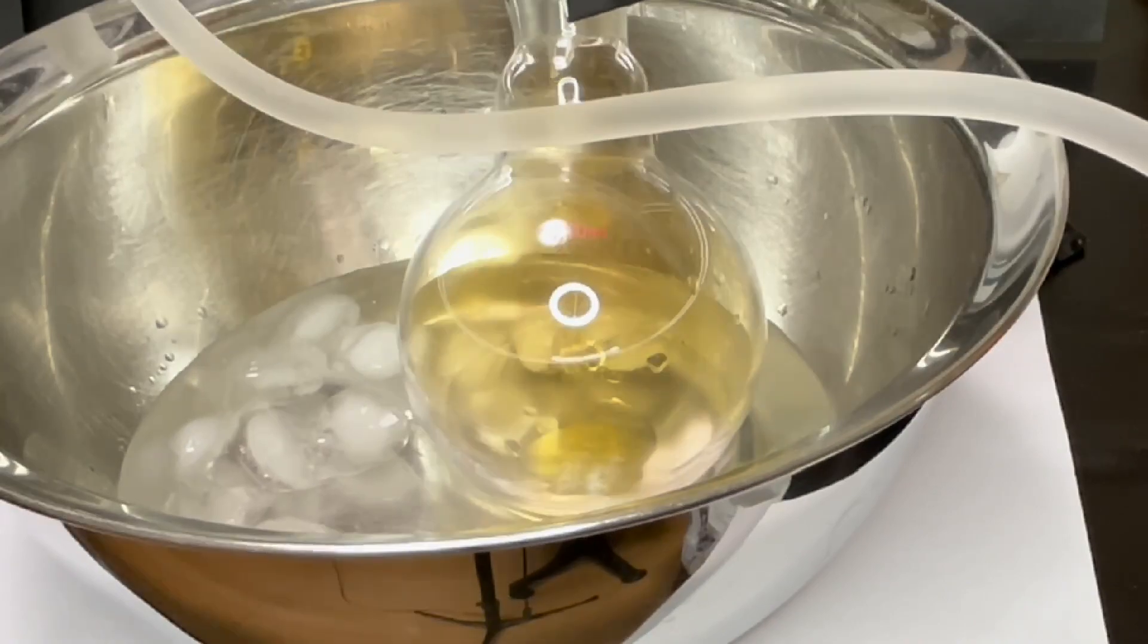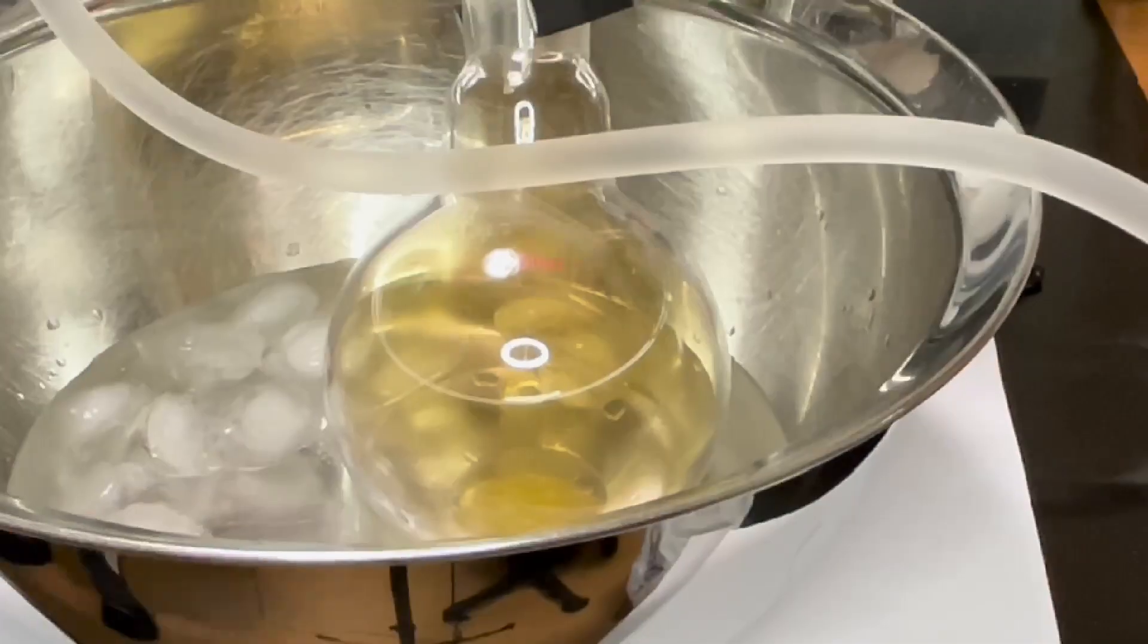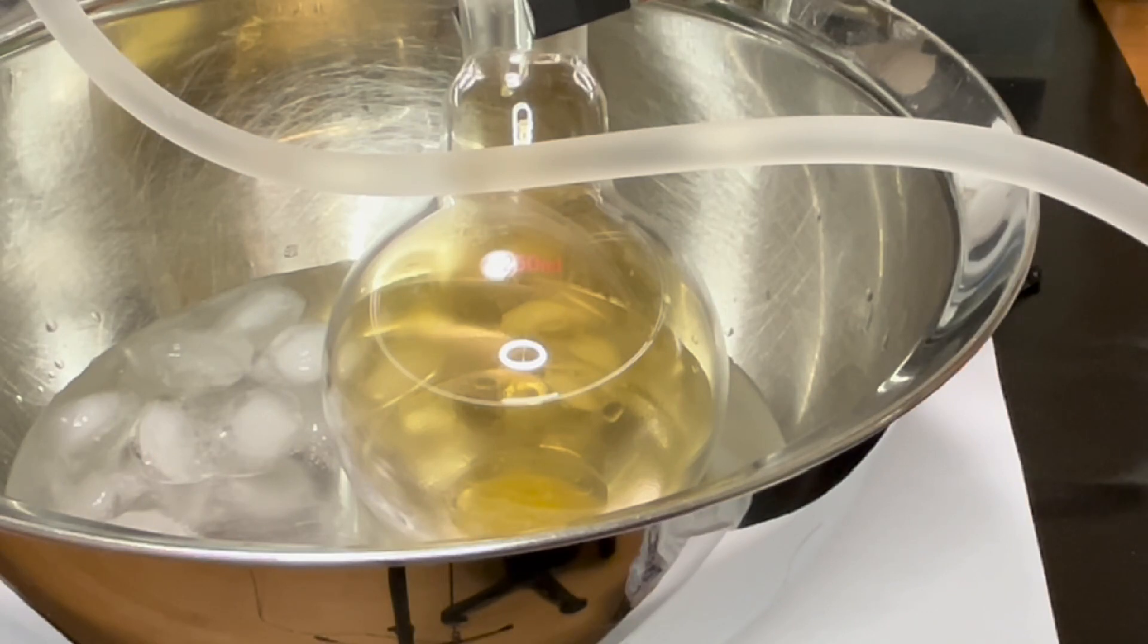You can see the nitric acid is dripping into the flask. I will have to wait for another 3 hours to collect more nitric acid.